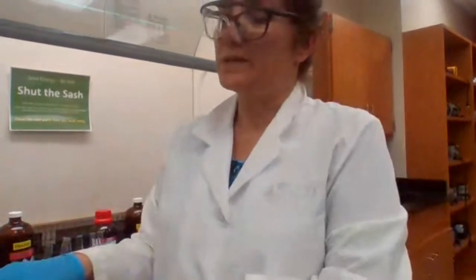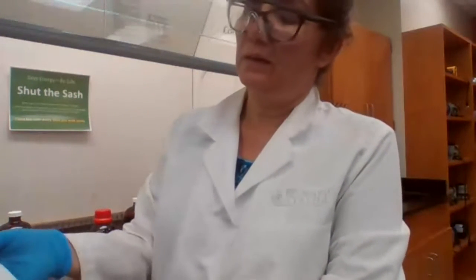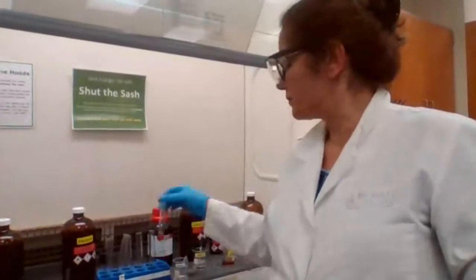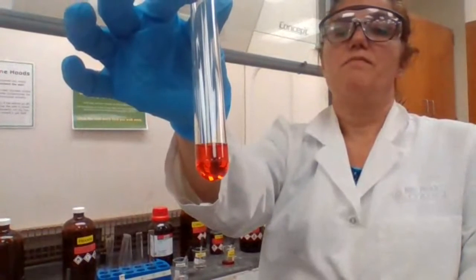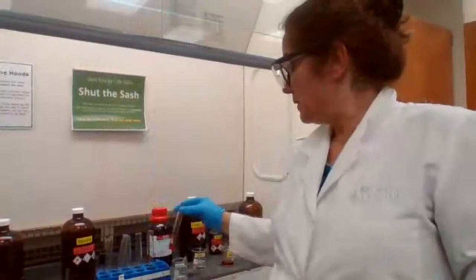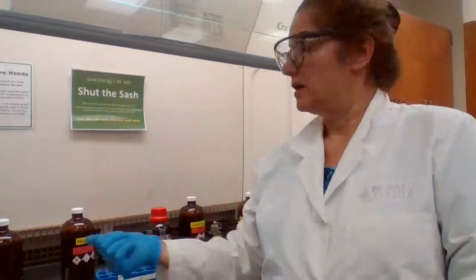Okay, next one. Potassium permanganate solution with the hydrocarbon. What do you expect? What is going to happen if you add potassium permanganate? Dominic, this is toluene and bromine. What's next reaction? Permanganate, potassium permanganate with hydrocarbon.